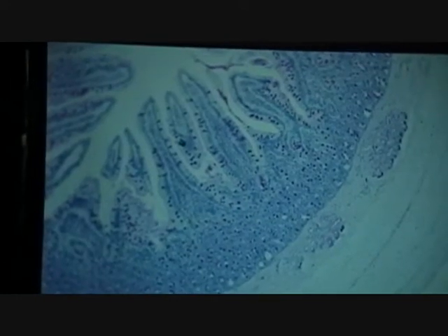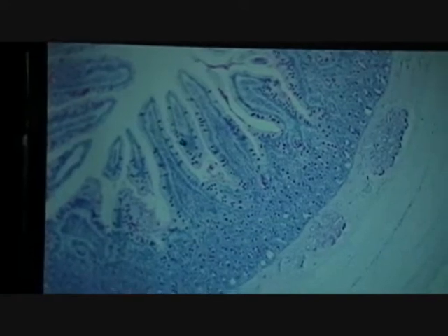Now this is just a little odd stain here to sort of give you the obvious difference between goblet cells and mucus cells. But I would never use this for an overall identification. What happens here is that the stain will stain goblet cell mucus a kind of magenta color, whereas mucus cell mucus will be dull. Just a little bit hazy, but not nice and magenta.